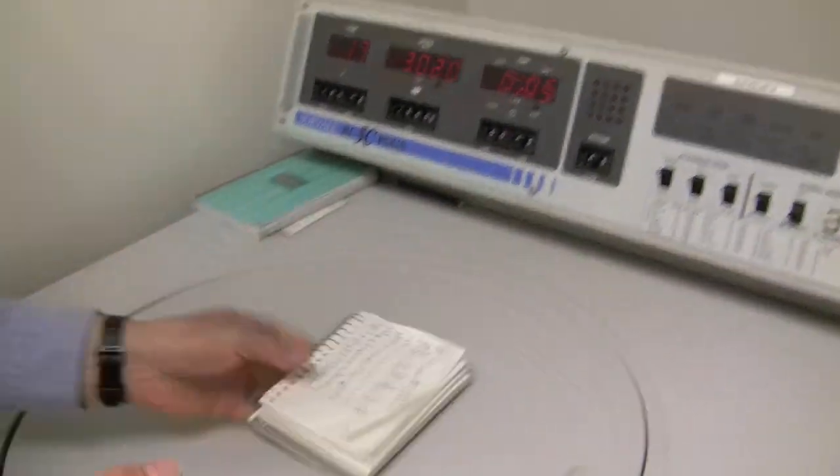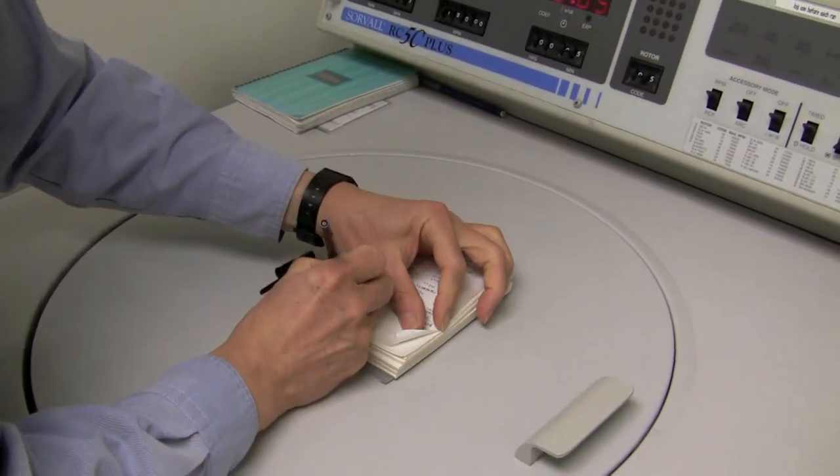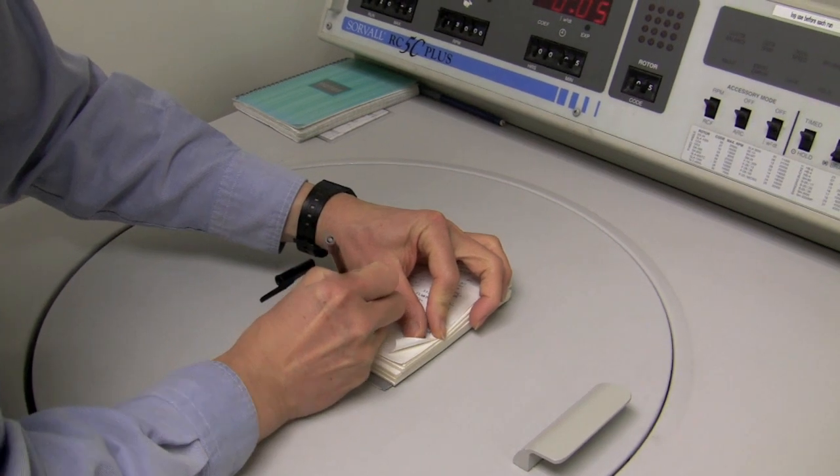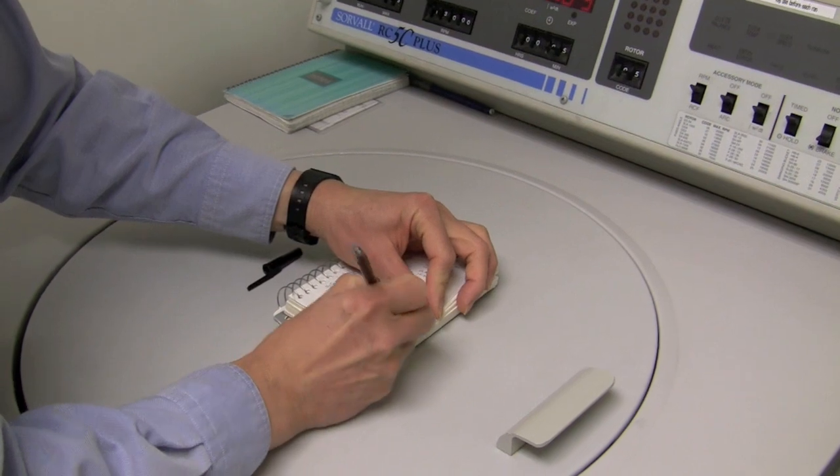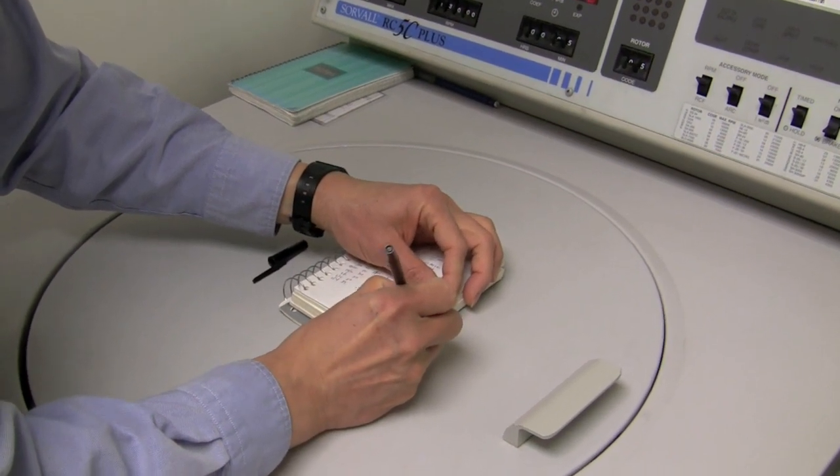You also want to take this opportunity to sign the logbook. So today is the fourth, and I'm running at 13,000 RPM, five minutes, SS-34, and I'm spinning down DNA.